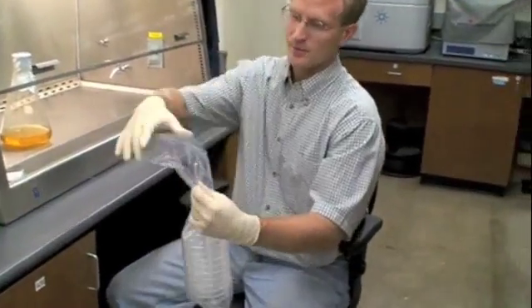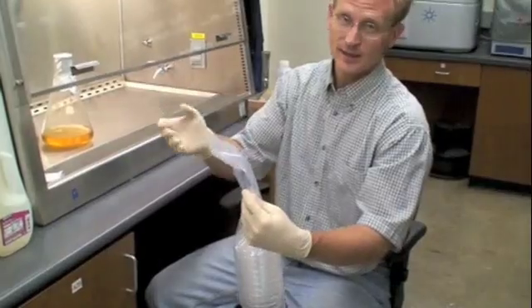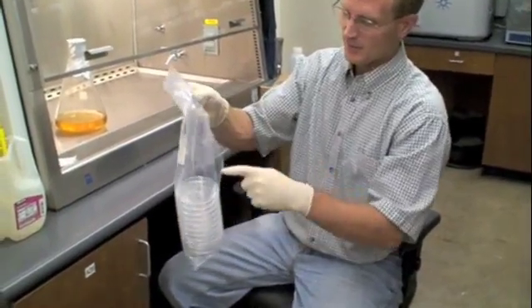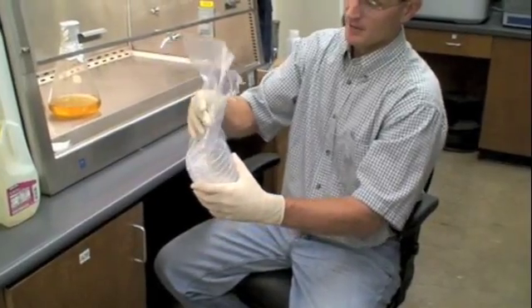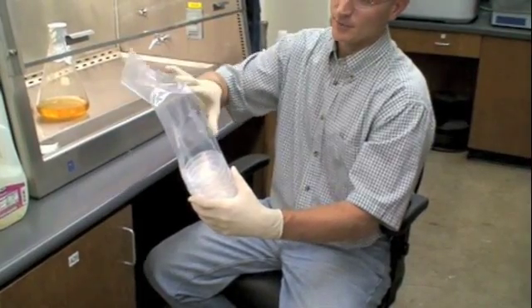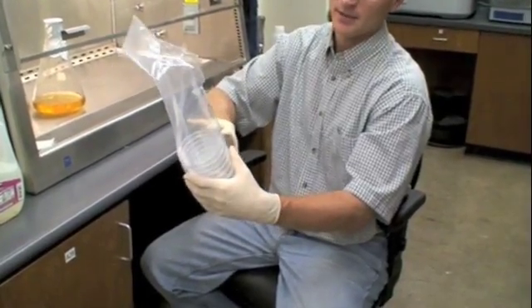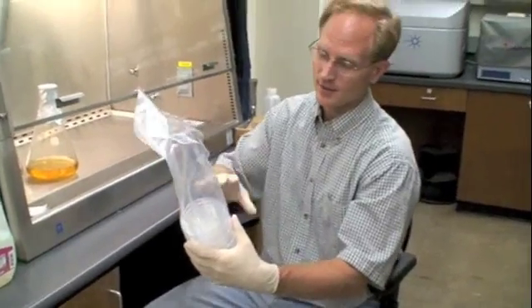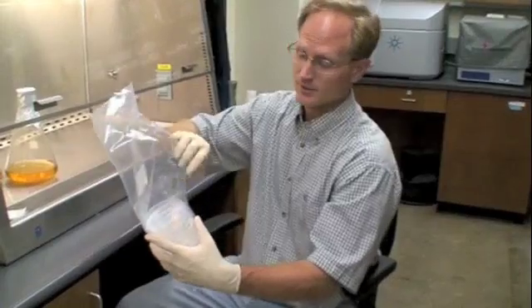What happened was someone ripped open the top, which is fine, you've got to get them out somehow. But they ripped it all the way down to here. The problem is that the 10 that were used originally, that's fine. But then these have sat up on the counter for, I don't know how many weeks, and they could have been contaminated because it wasn't closed.